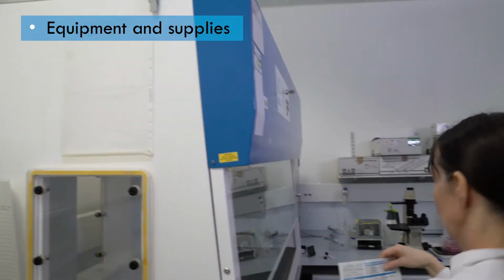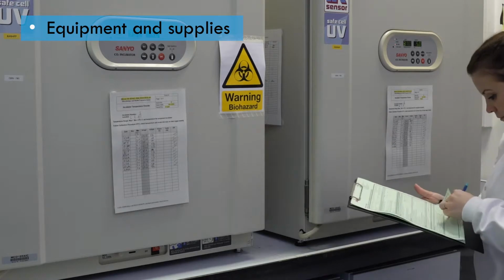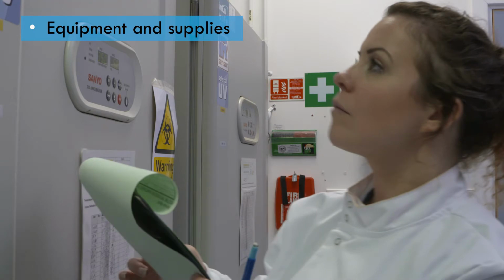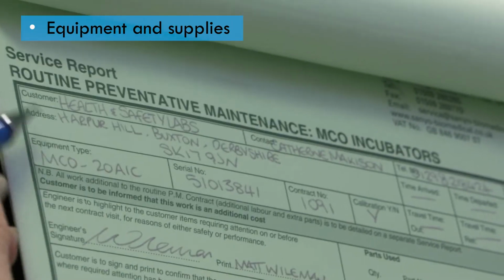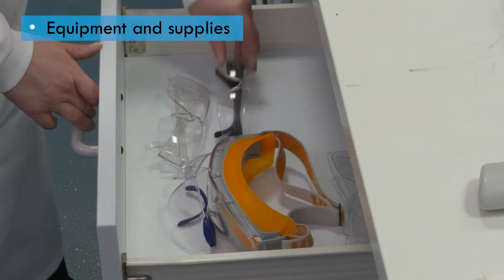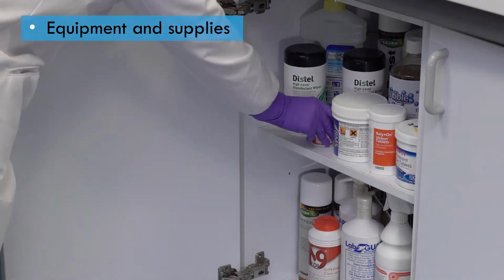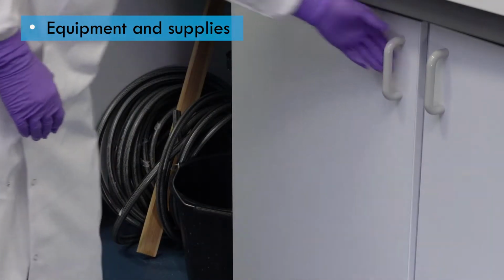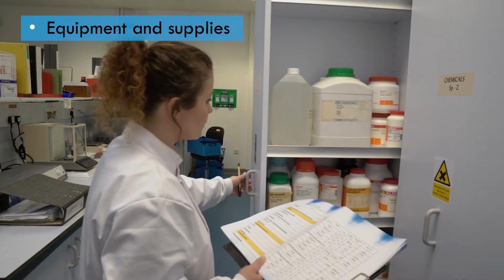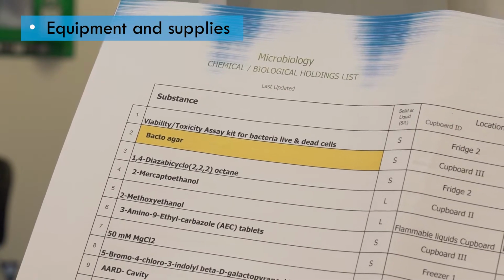Work cannot flow smoothly without the right equipment and supplies. There should be procedures in place to make sure that equipment is checked regularly and properly maintained. Supplies such as PPE, reagents, and stocks of biological agents and chemicals must be stored correctly. A log and regular stock check must be in place to ensure there are enough supplies to do the work.